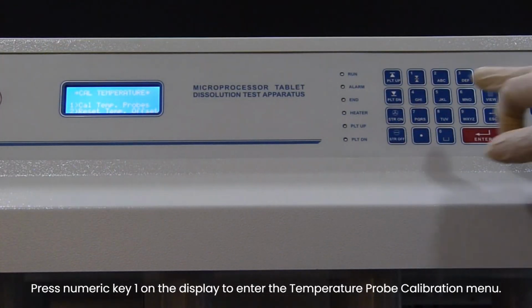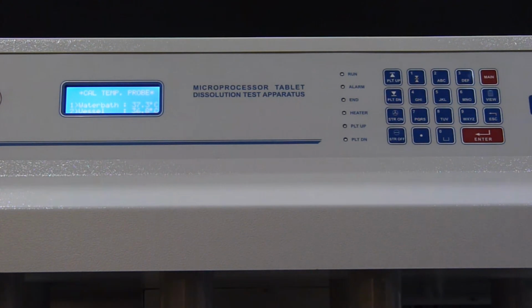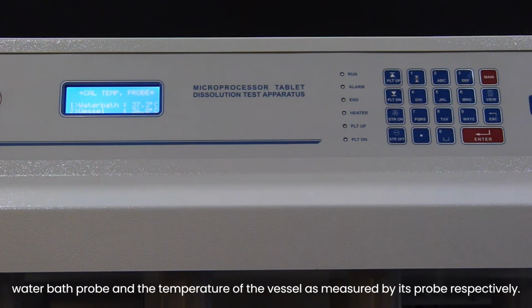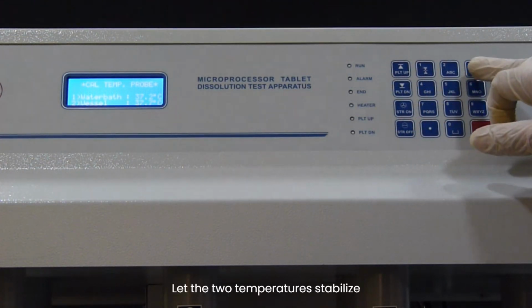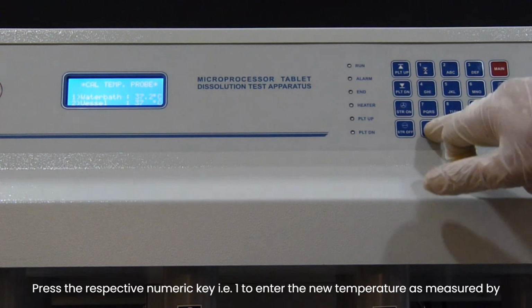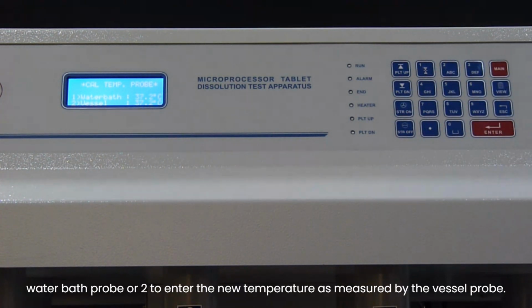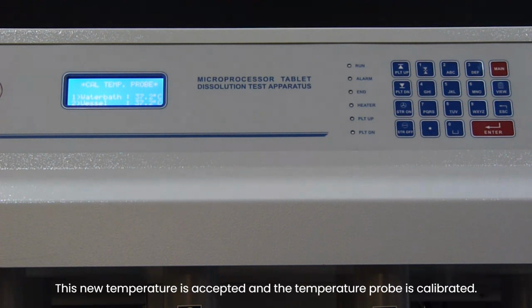Press numeric key 1 on the display to enter the temperature probe calibration menu. The display now is showing the current temperature of the water bath as measured by the water bath probe and the temperature of the vessel as measured by its probe respectively. Let the two temperatures stabilize. Press the respective numeric key, that is 1 to enter the new temperature as measured by water bath probe or 2 to enter the new temperature as measured by the vessel probe. This new temperature is accepted and the temperature probe is calibrated.